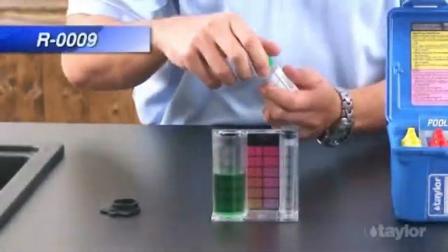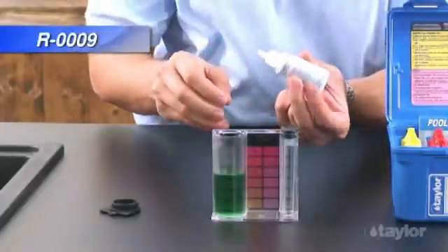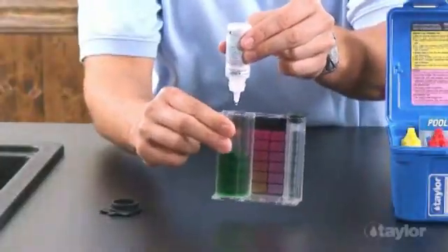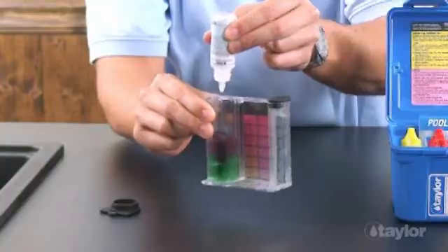Add reagent 9 dropwise. After each drop, count and swirl to mix until the color changes from green to red.